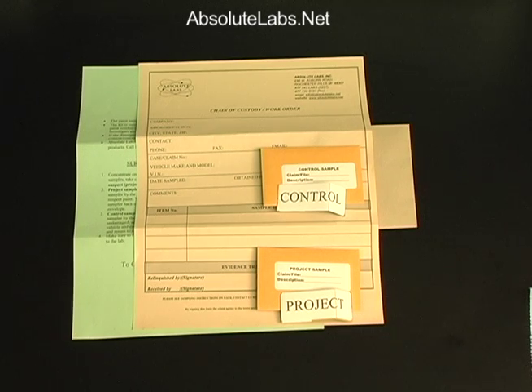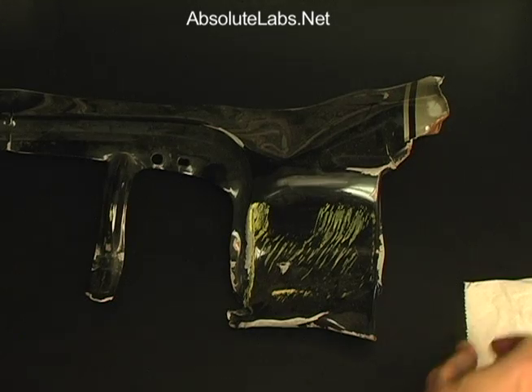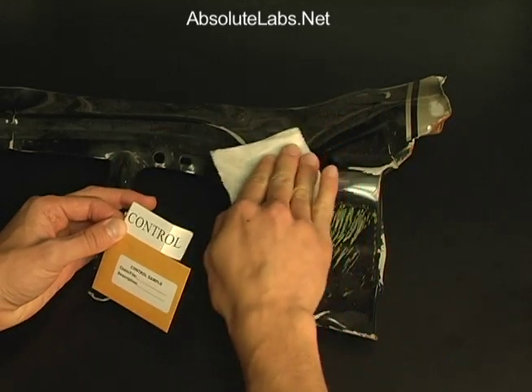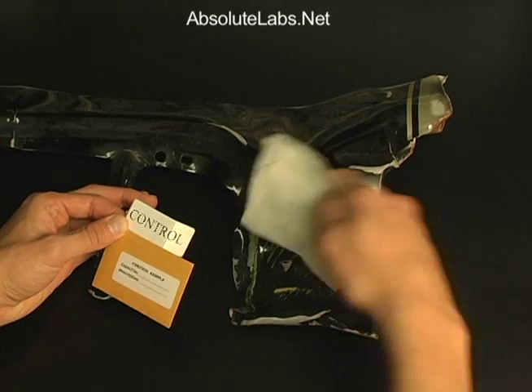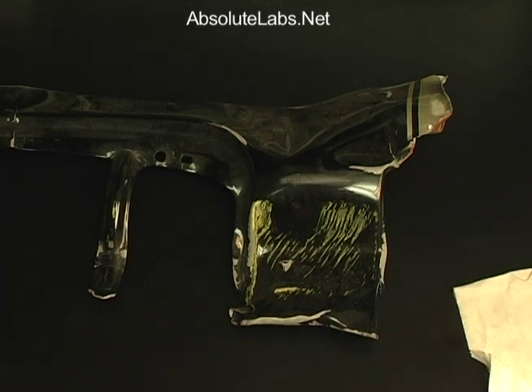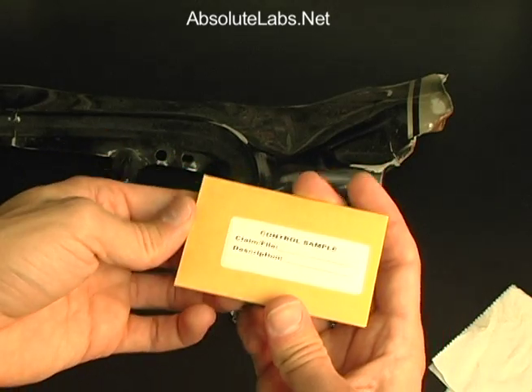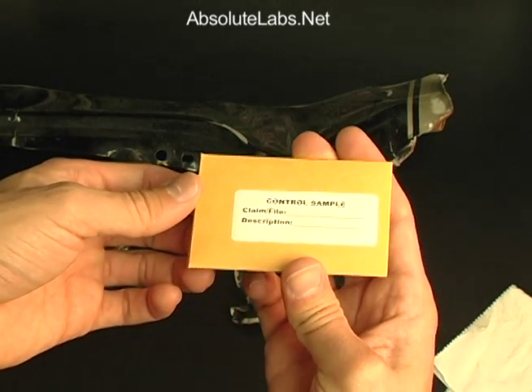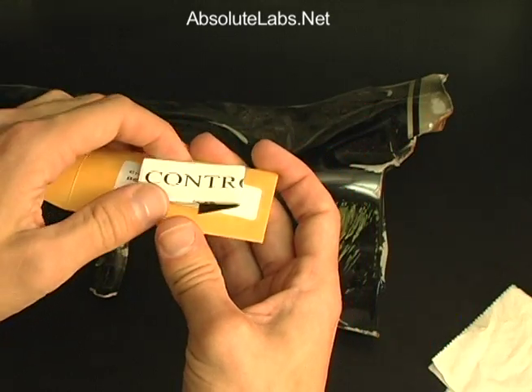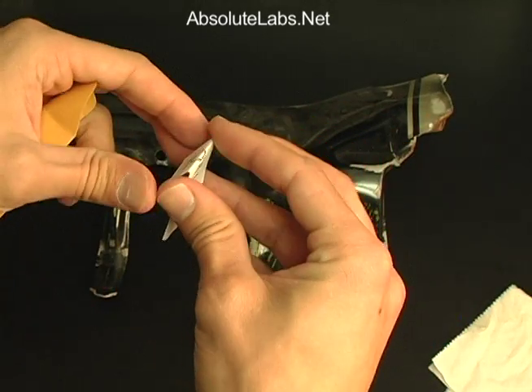The following instructional video will show you how to properly take samples. Taking a control sample: if debris is present on the control area, remove it with a clean cloth. Next, take the envelope labeled 'control' and remove the abrasive sampler, being careful to use the edges to open up the sampling surface.